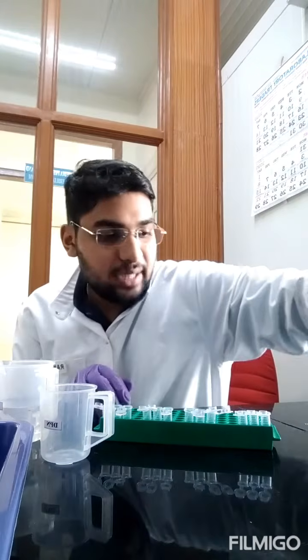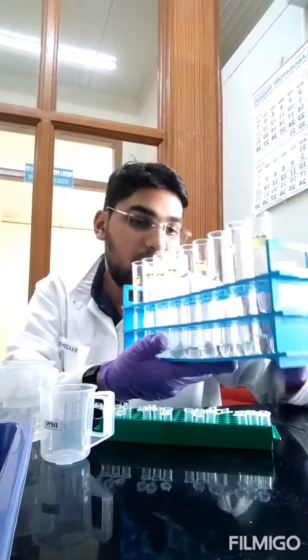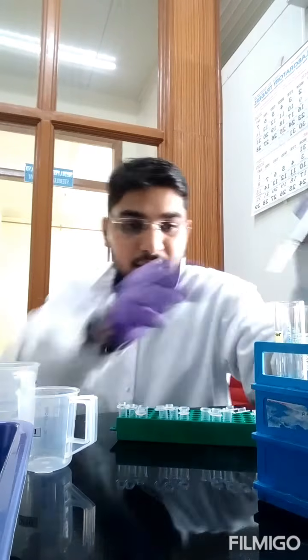So like this I have done for all other samples. You can find here the clear solution, the supernatant we have collected. From this supernatant of all these samples, we are going to pipette out 200 microliters. This is for the microplate reading. If you are doing this in a test tube, you can pipette 2 ml accordingly. You can convert into whichever ratios you feel comfortable with. Since I'm doing it in Eppendorf tubes, only a small amount of sample is required, so I'm pipetting out 200 microliters of each sample.